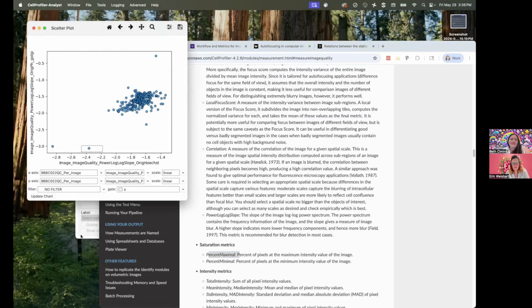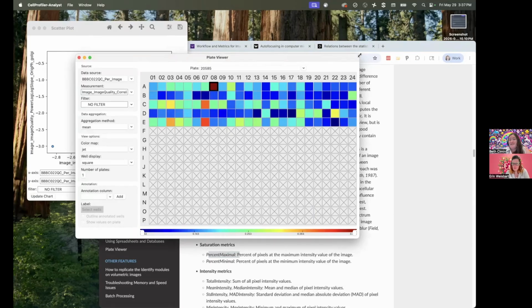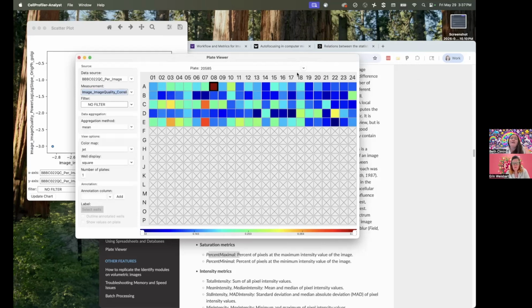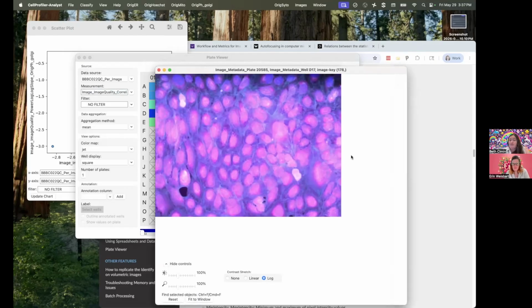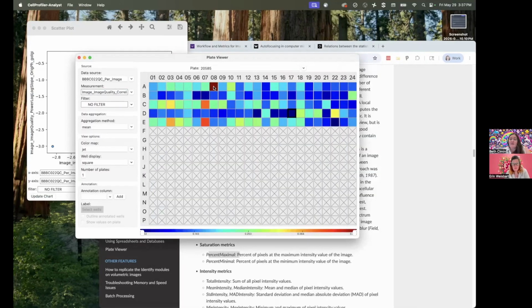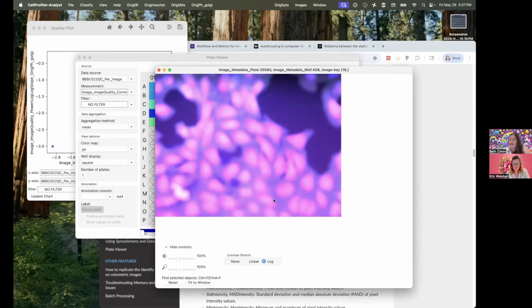So this is some CellProfiler Analyst data from the CellProfiler quality control tutorial. Here we're looking at one of the image quality metrics, which is correlation in the ER channel at a scale of 20 pixels. Again, the higher this number is, the more likely we think there might be a focal problem. So we can check a really low image. For some reason, all of these look bad in linear scale. That looks indeed like a perfectly fine image. And then something with a really high value, that indeed looks like a blurry image.